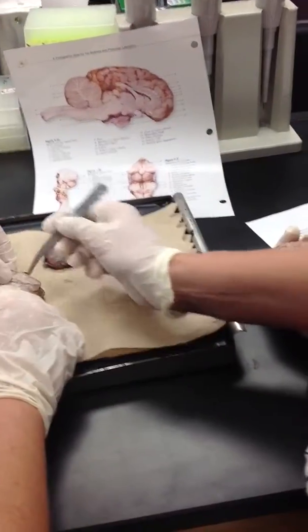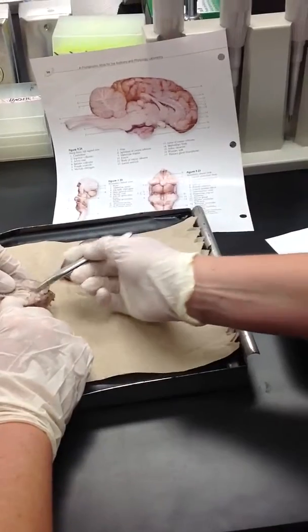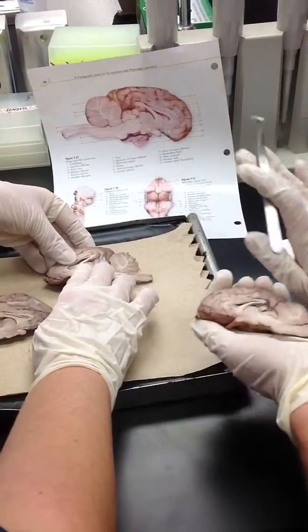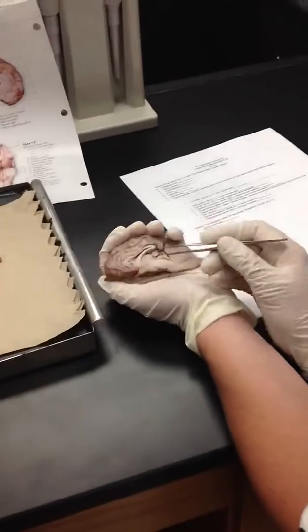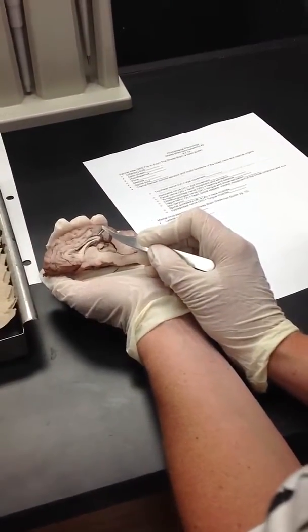And so that's in the middle, the septum pellucida. See that? There's no hole. Exactly. So that is a membrane that separates the two ventricles. That means you cut almost perfectly right down the middle. I did. I would be a good surgeon. I can cut pretty good.